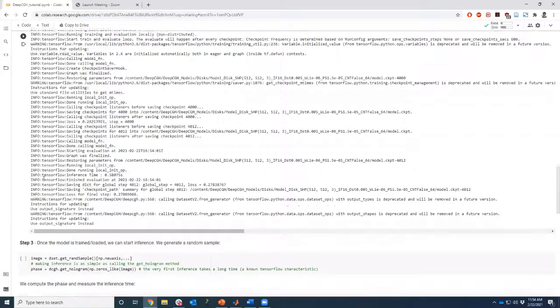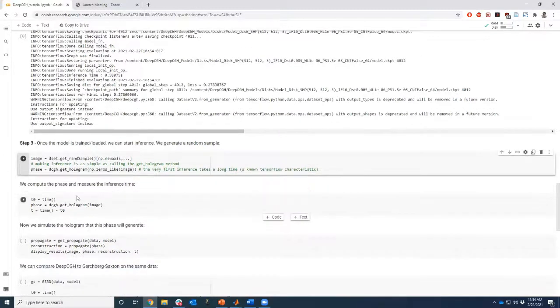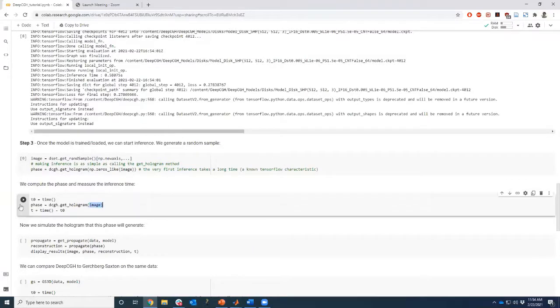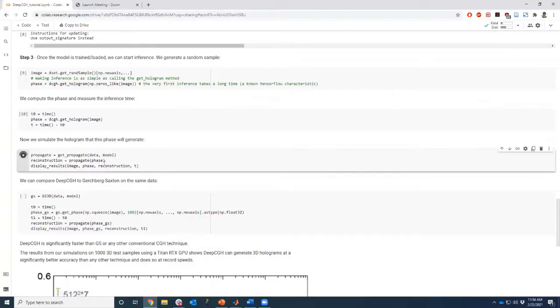All right, I think that's it. So once the model is trained, sorry, go ahead, Haas. Yeah, it was done. I was just saying. So once the model is trained, we generate a random sample. So we pick one of the images, and the input is our image data. The output of the DCGH hologram is the phase. So we can run this and time the operation, and then we can use the phase that we calculated to propagate a simulation of the hologram, create a reconstruction, and display the results.